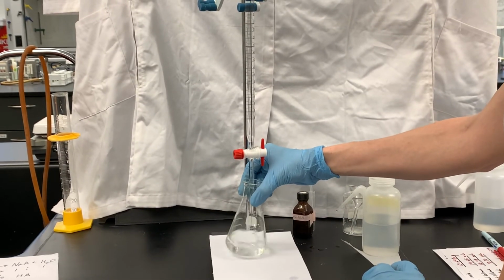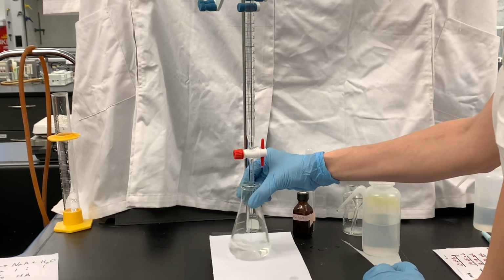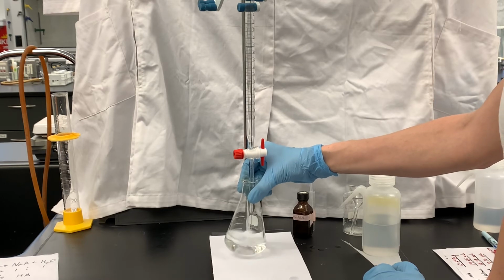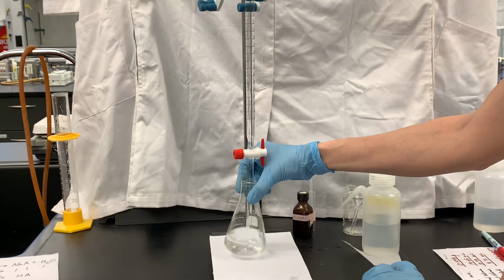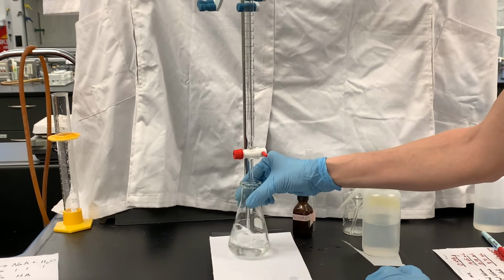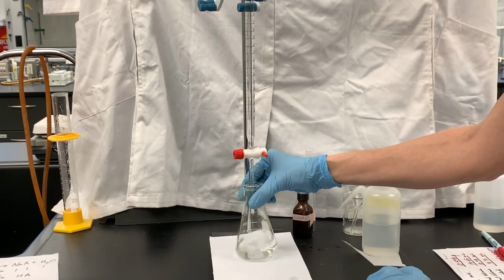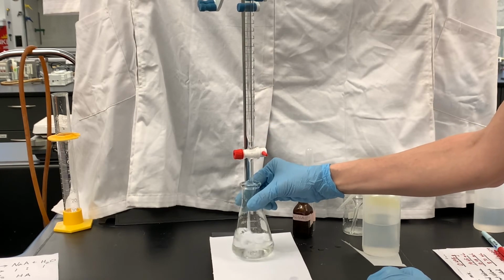And right now I'm titrating kind of quickly because I'm just looking really carefully to see any sort of initial color changes to pink. As soon as I see any sign that this is slowly starting to turn pink, which it is now, I'm going to start being a little bit more careful. And that was barely pink. You may not have even been able to see that because it was such a light color pink.